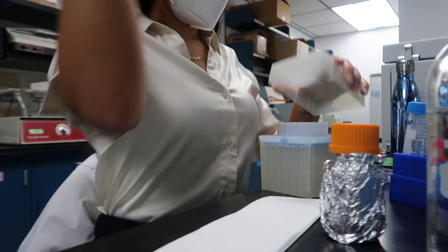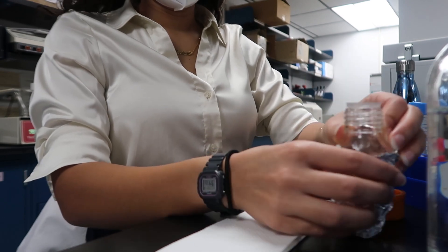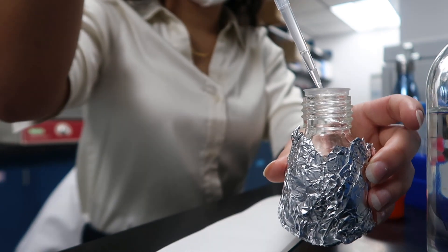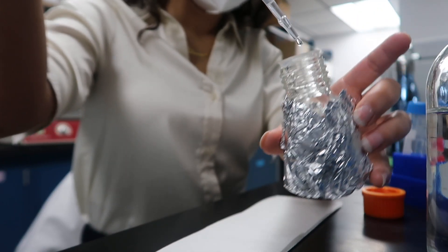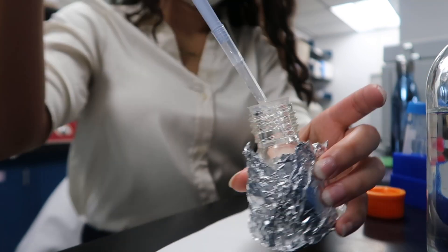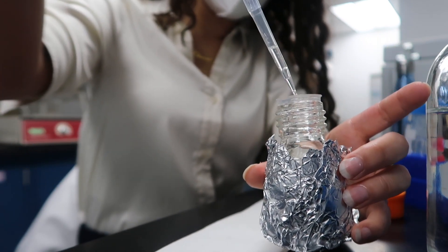Every step of an immuno is the most important step. So I got my Tween right here. I'm going to go in with this pipette. Tween is kind of viscous — didn't expect that. I'm going to suck it up one more time just to make sure I got 250. Slowly. I feel like there's an air bubble in there. Okay, third time's a charm. It looks the same every single time I suck it up, so I'm just going to go with it.